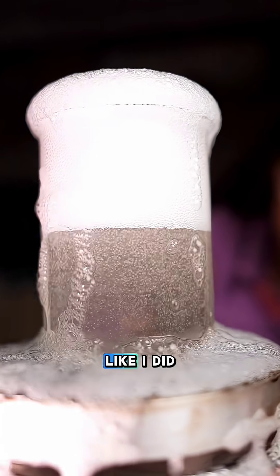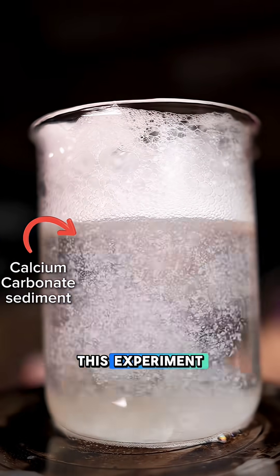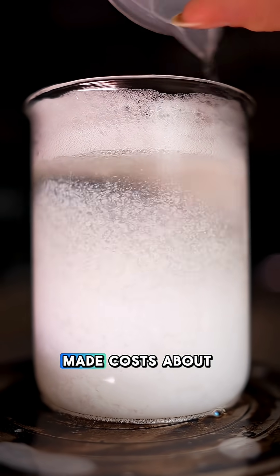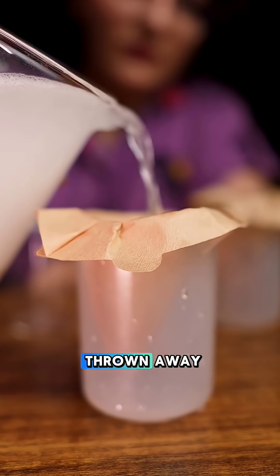Be careful not to get carried away like I did — it is really exciting though. The yield of this experiment depends on how carefully you work, usually between 60 to 90 percent. The calcium carbonate we just made costs about 40 cents, all from 30 grams of eggshells that would normally be thrown away.